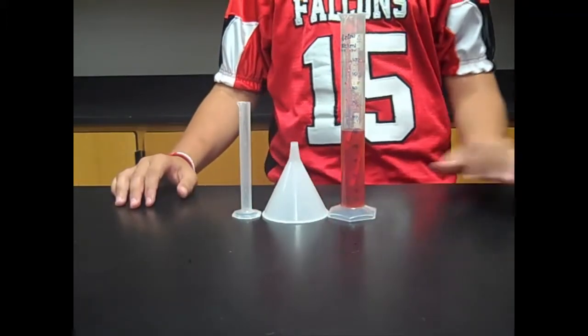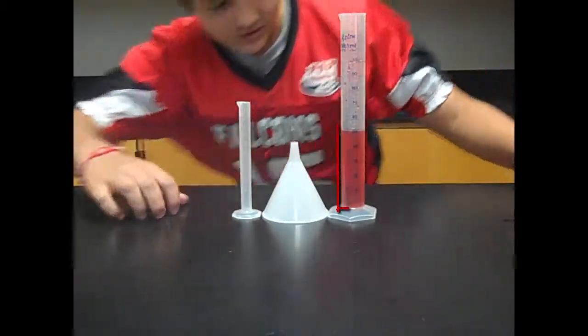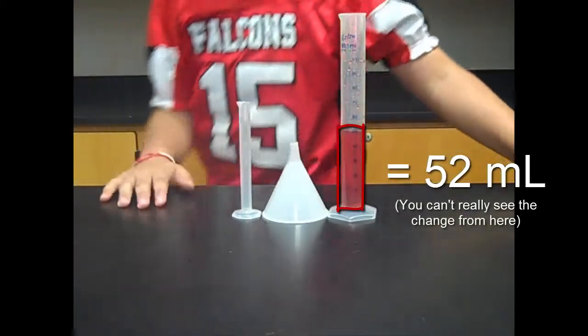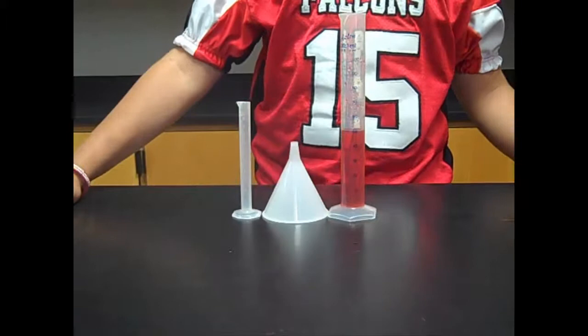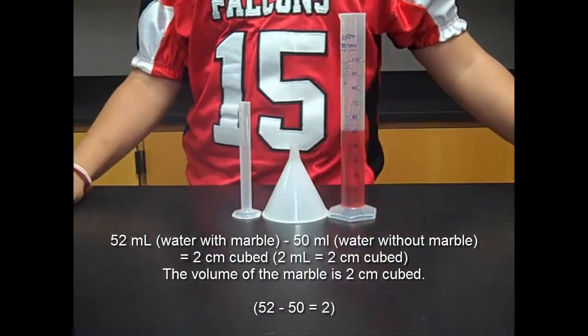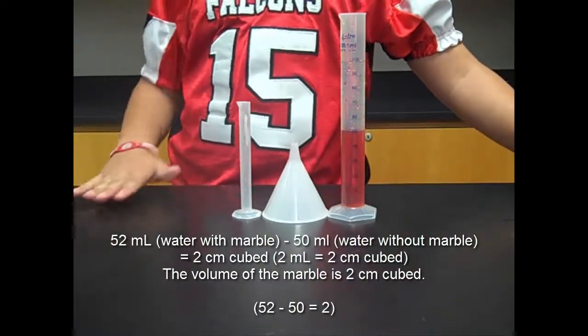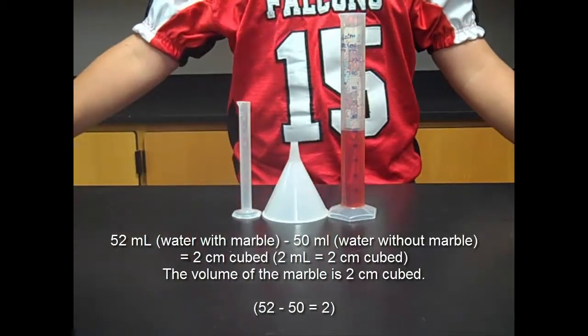You want to check how high the water raised with the marble in it, which is 52 milliliters. So you want to subtract 50 from 52, and that gets you the volume of our marble, which is 2 centimeters cubed.